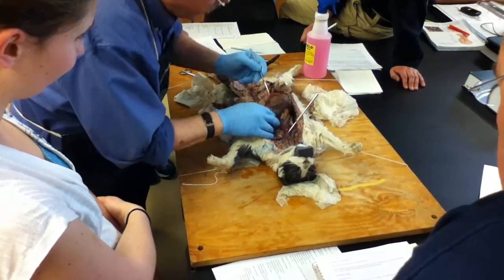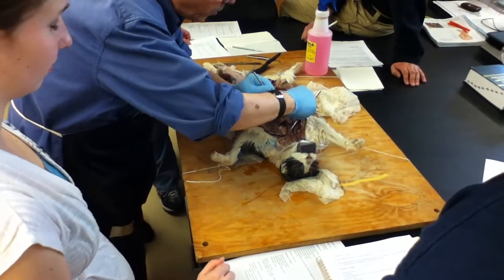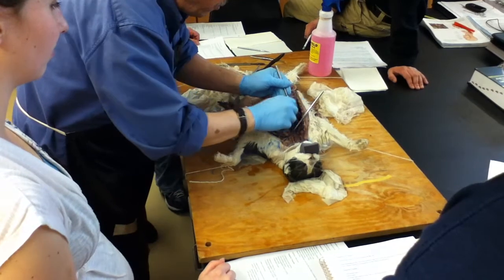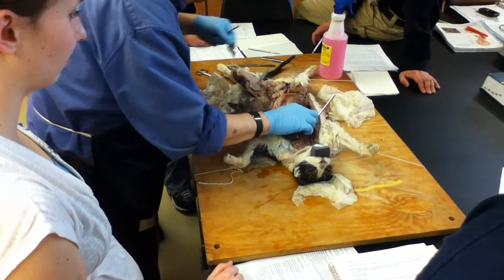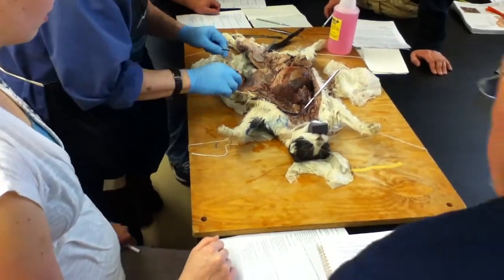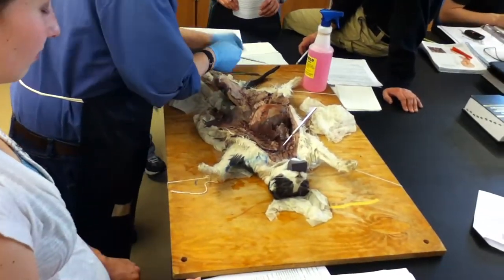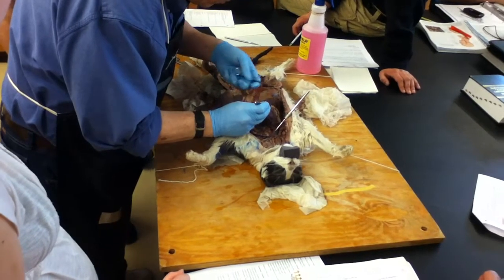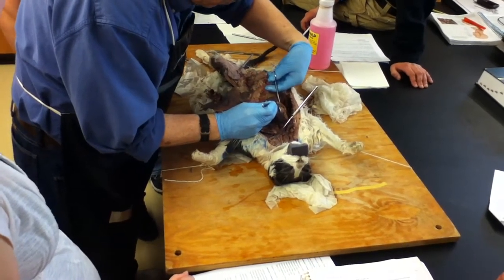And so now what we're going to do is through here, we're not totally tearing this apart. Farther back, and then a little bit more in the sac, so that when I cut under it, go through it, you can see the actual part. And I can begin to see the underlying part under there, which is quite nifty. Enter the sac.